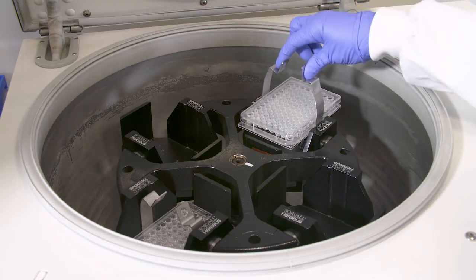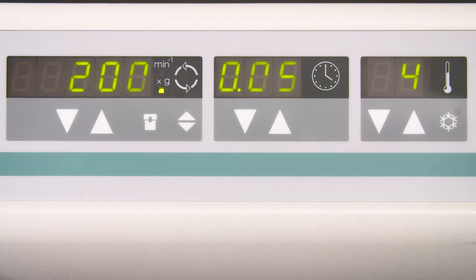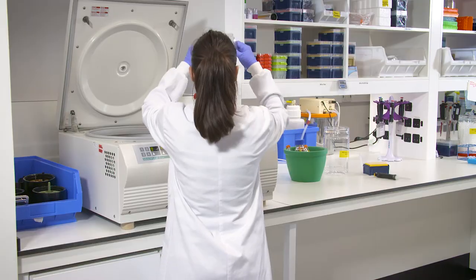Then centrifuge the cells at 200 g's for 5 minutes and discard the supernatant.